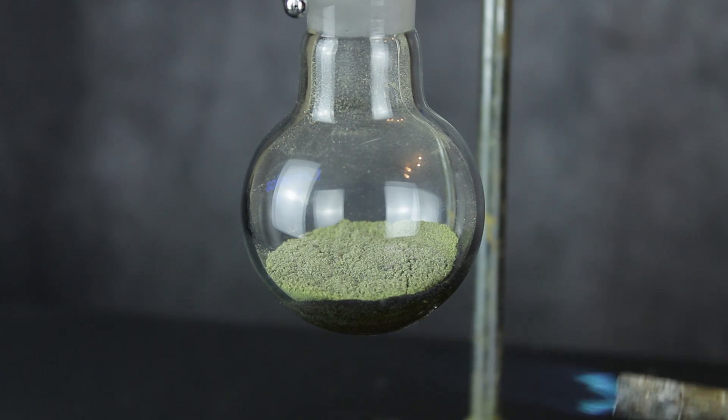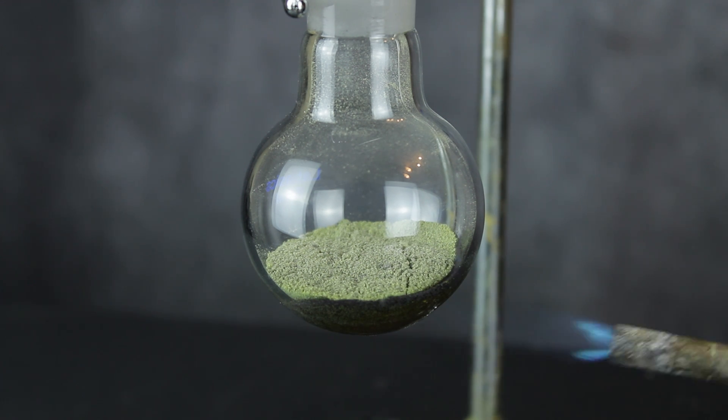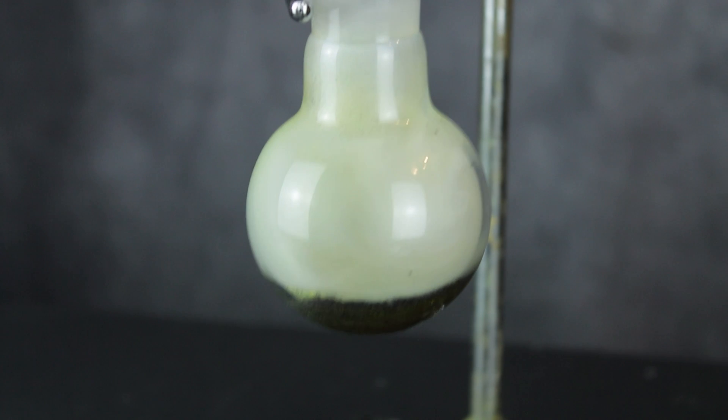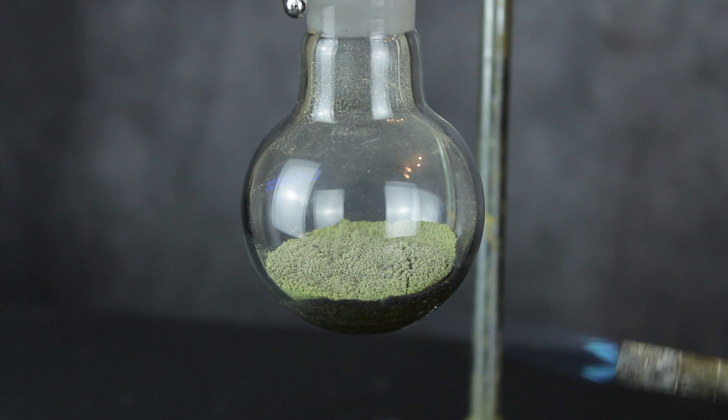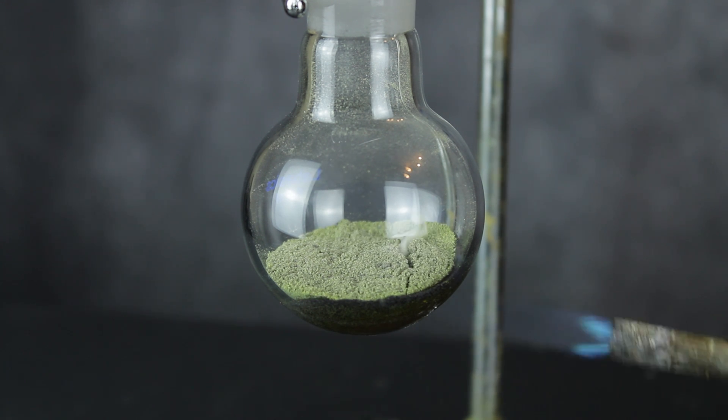It took a while for the flask to get up to temperature, but once it did, since I didn't have many references for this reaction, I was a little worried that the mixture would ignite violently, similar to flash powder. Thankfully though, that didn't happen and I avoided being blasted full of glass shrapnel.